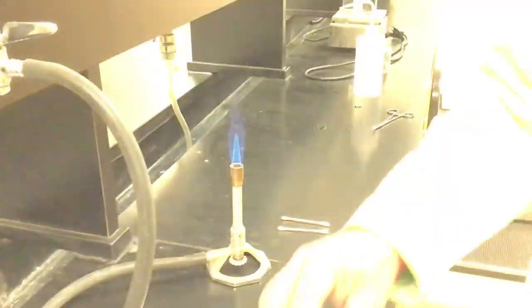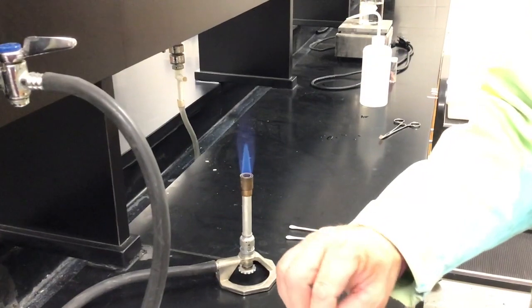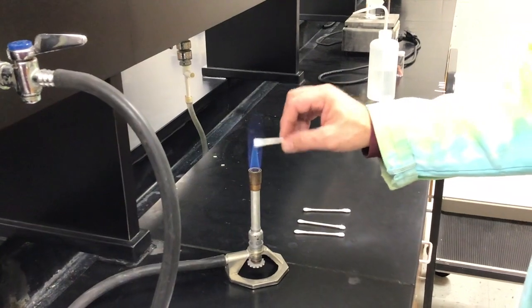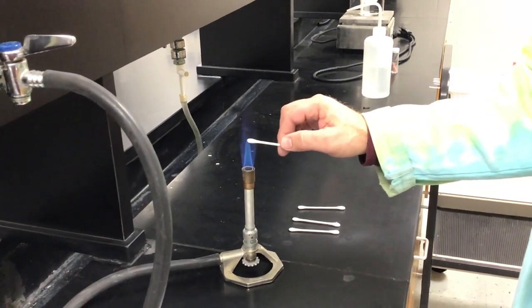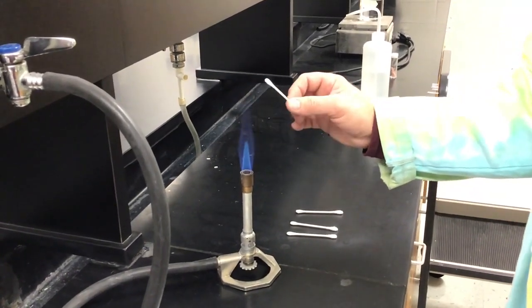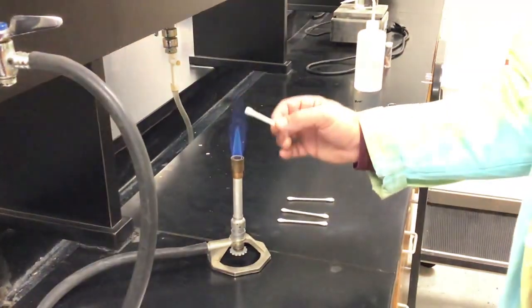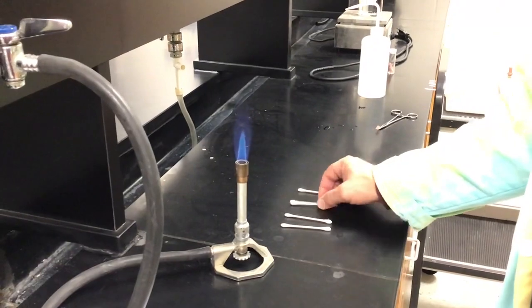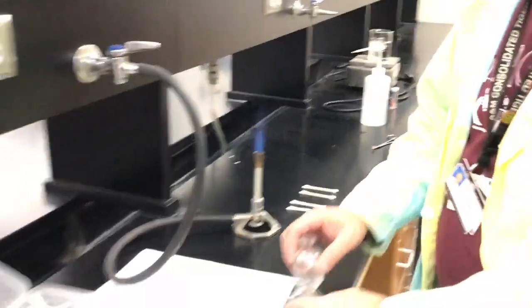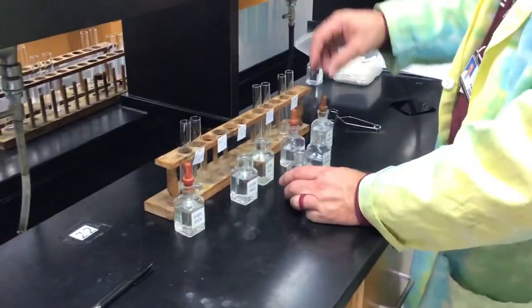Now we'll do it with our unknown, the same way, and get this to heat up a little bit. Come on, Mr. Ion. There it is. We'll do the same with the cobalt blue glass. Get your finger over it. Okay, all right. There we go. One more time, take the blue glass off. There's your unknown, and now we'll look at our actual other one, and see what you think. Okay, that takes care of potassium chloride.